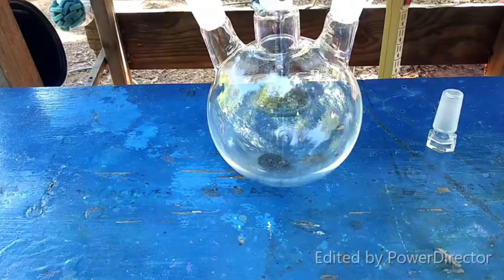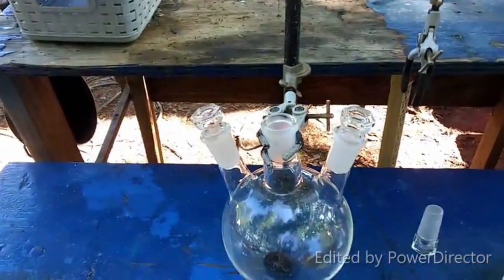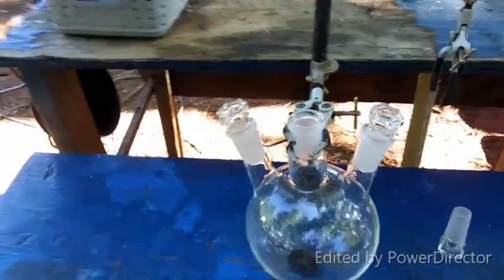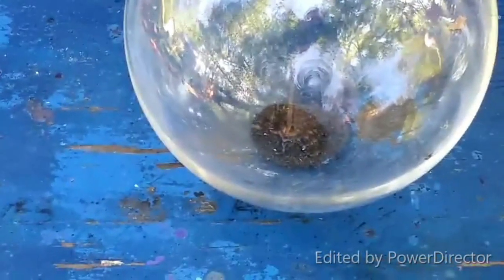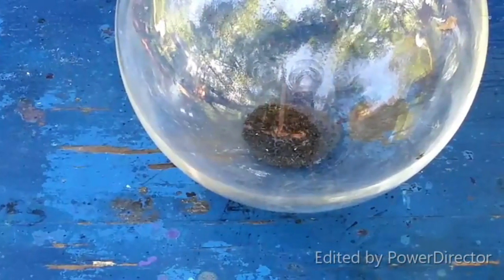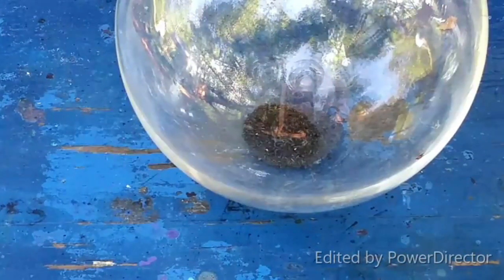This is just a couple percent nitric acid. I just want to see what it will do with the very dilute stuff. And it looks like not much. There's not really much of anything to see. So let's hit it with the more concentrated stuff.